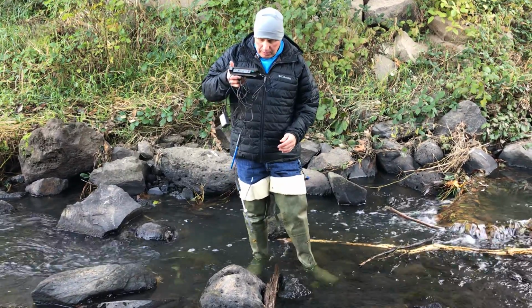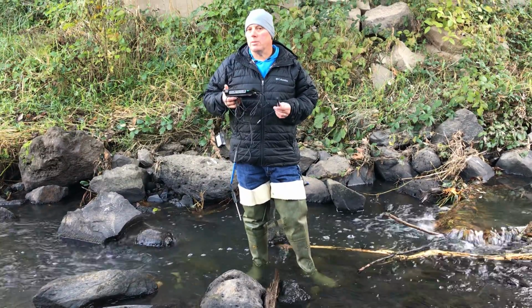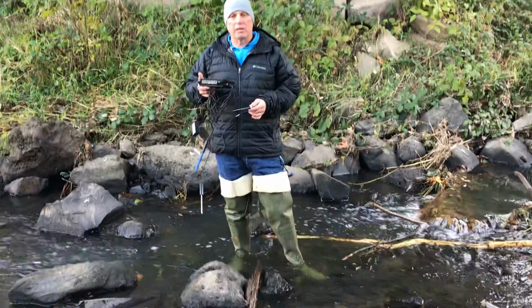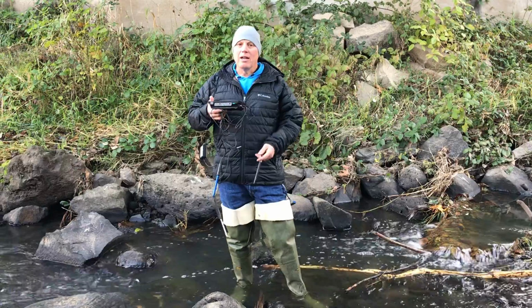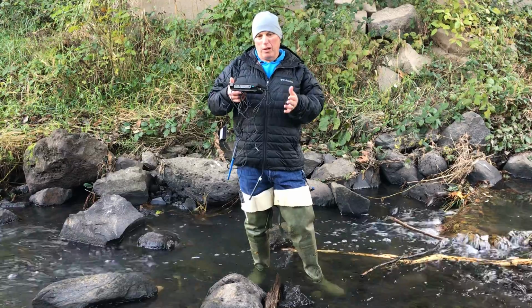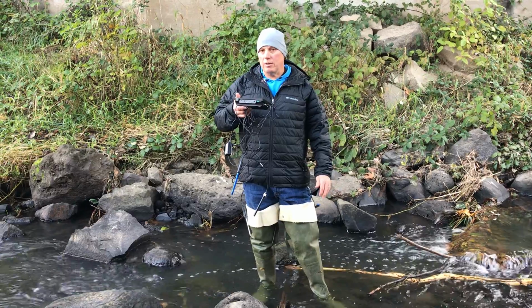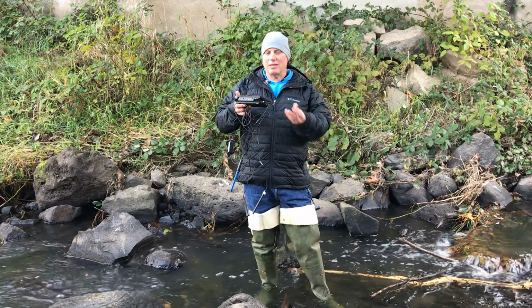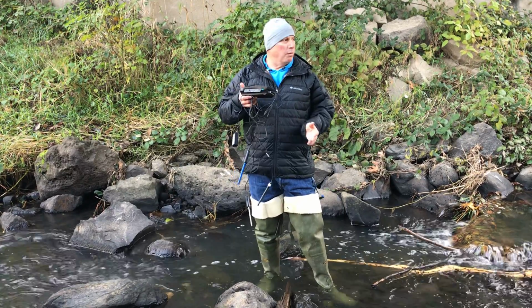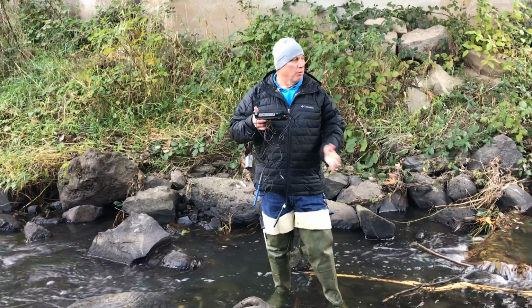All right, the last one we're gonna do is we're gonna check conductivity. Oops, there's my conductivity probe. Conductivity basically shows how many pollutants are in the stream itself. What it does, it runs a little current through here, and if it picks up more pollutants, then we're gonna get a higher conductivity reading. And so we like a nice low conductivity reading, and I would expect it somewhere, say between 50 and 150. That's pretty standard. But fish are pretty hardy. They could tolerate as much as 500. Anything above 500 would be really bad.